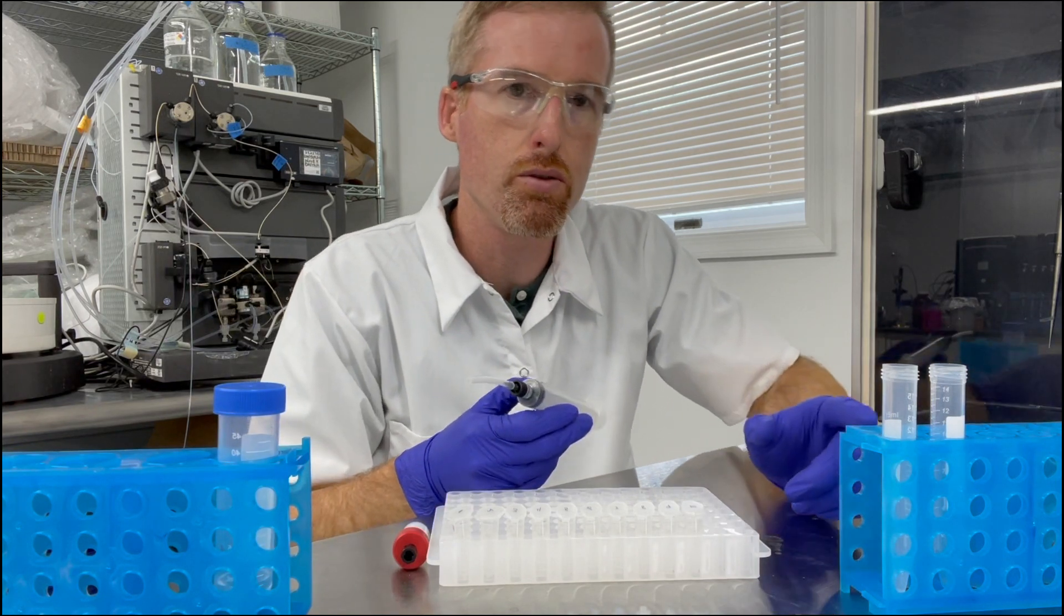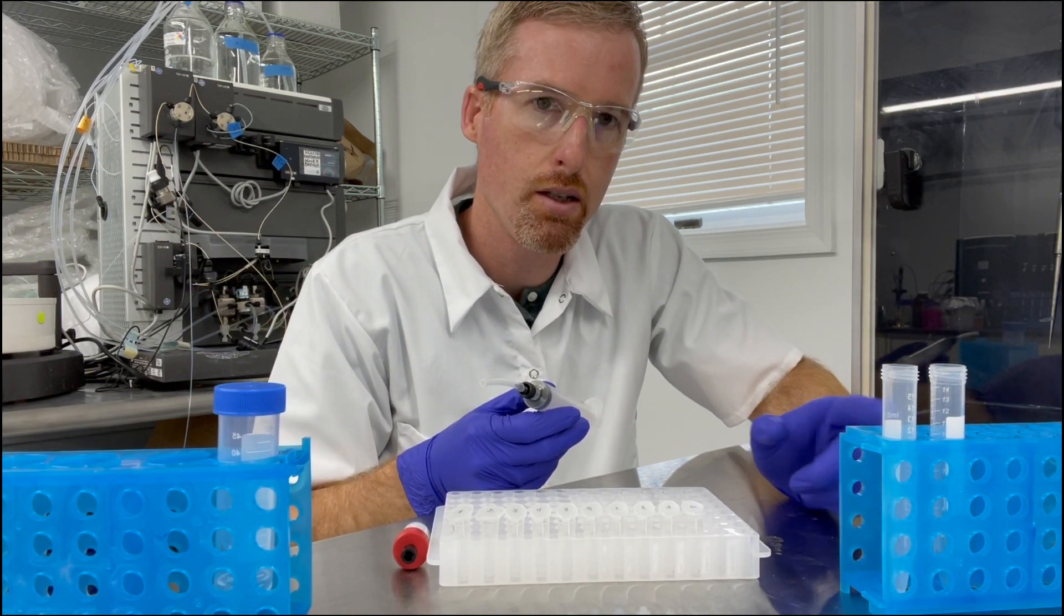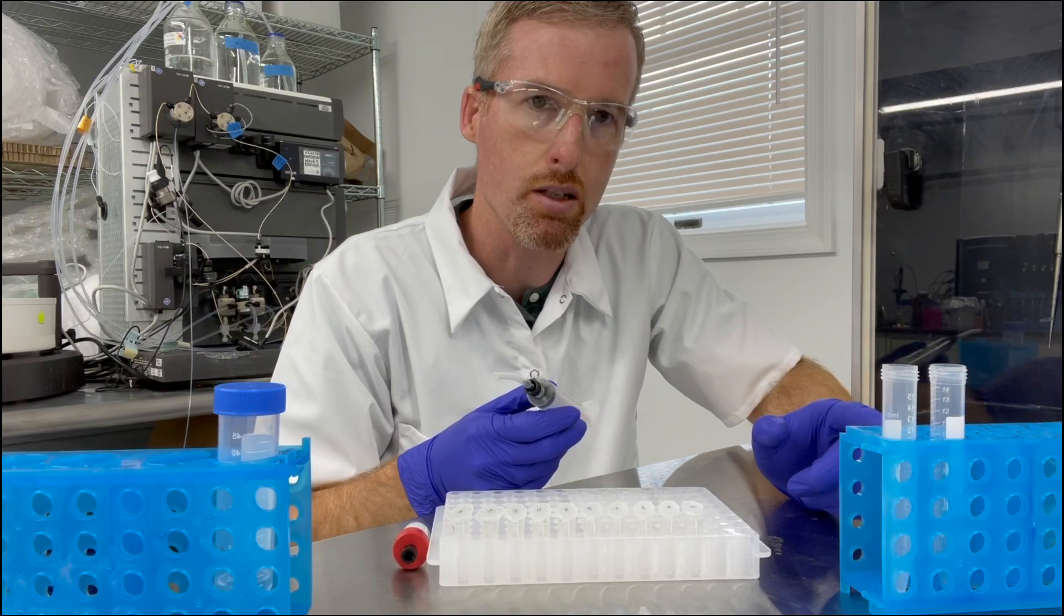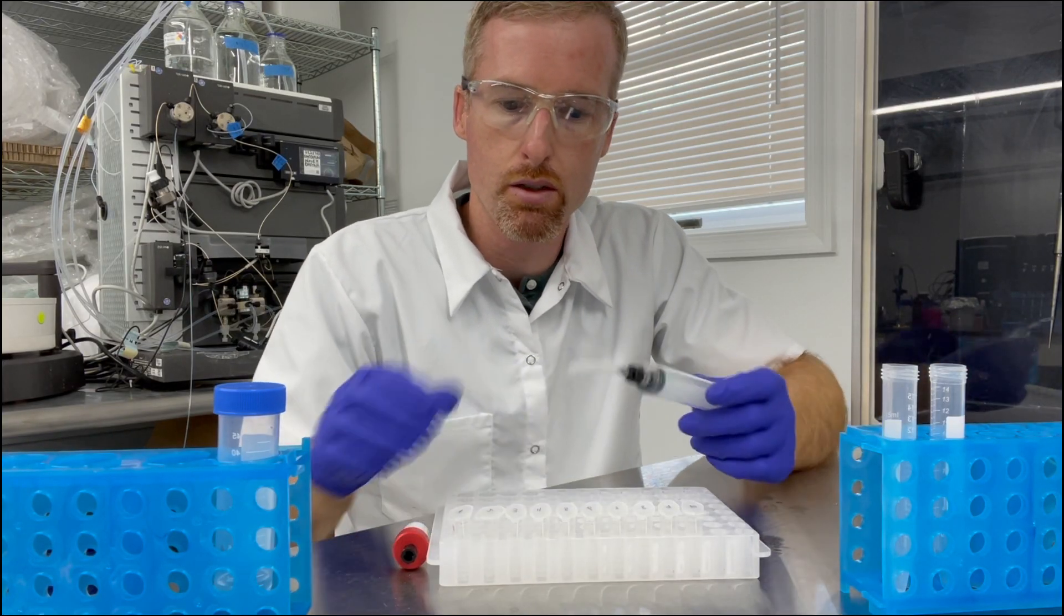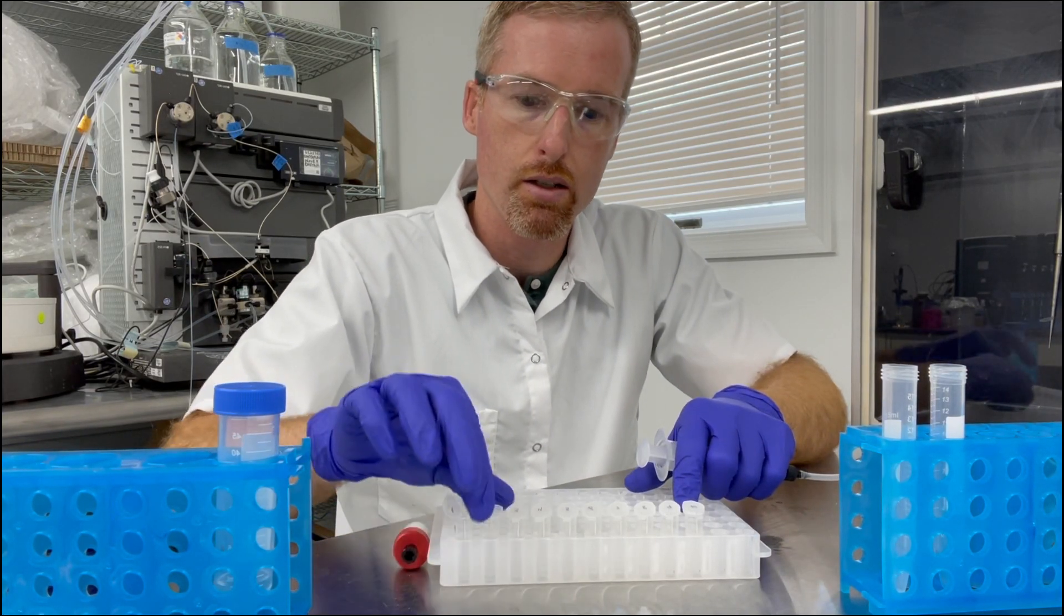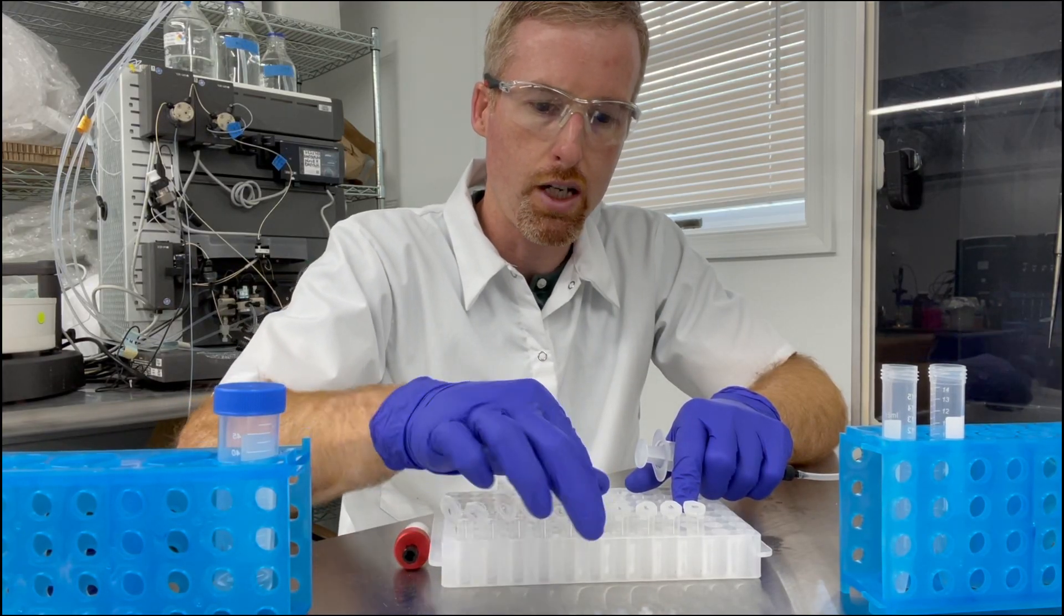I have two labeled tubes. One is going to be for the waste. One is going to be for the protein flow through. So let me go ahead and get the protein out of these fractions.